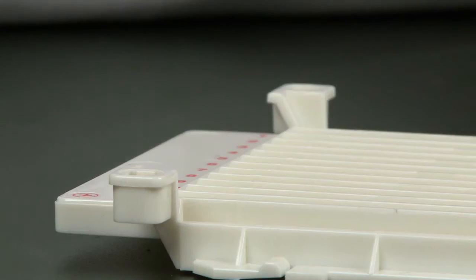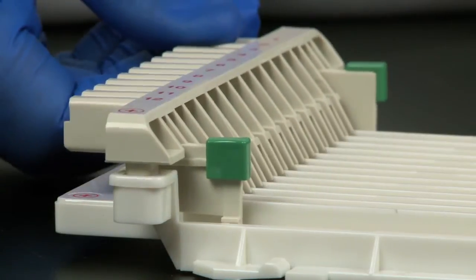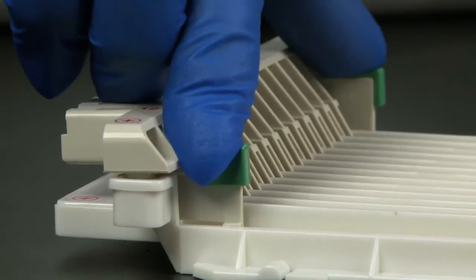Press the electrode assemblies straight down into the tray by pressing on the green tabs until you hear a click.